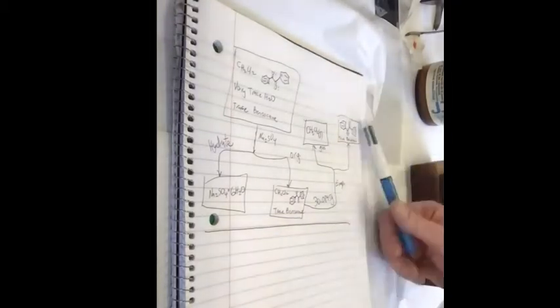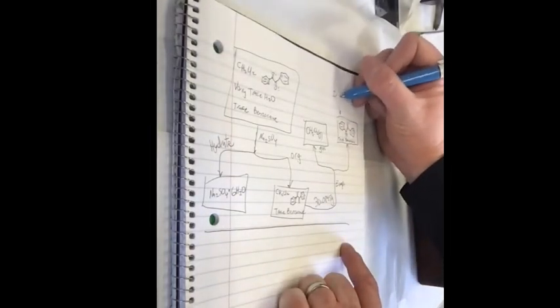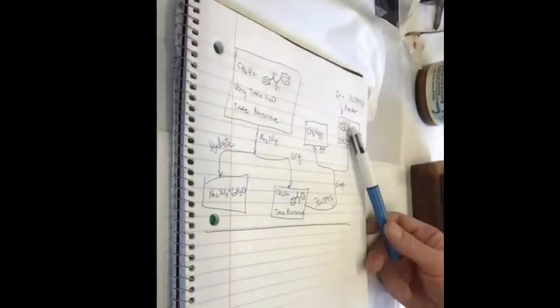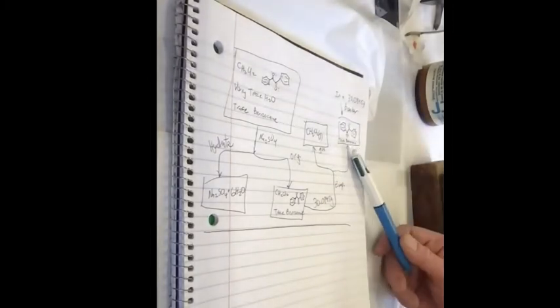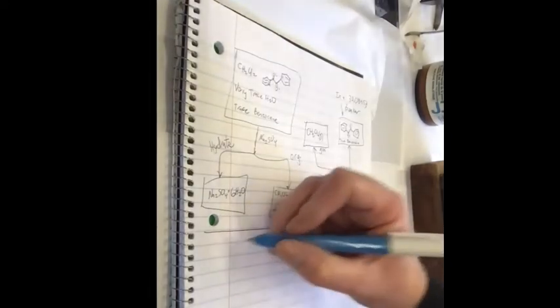Okay, so we're waiting on that, and this is done in a 30.0845 gram beaker. So we'll be able to get the mass of it afterwards, and I'll also take an IR to make sure it is benzil. Mostly benzil. We'll probably see maybe some traces of the benzocaine. We'll see. Now back to the aqueous layer.